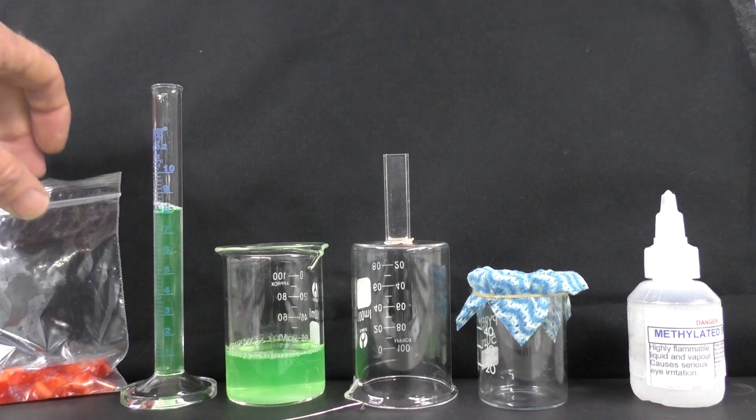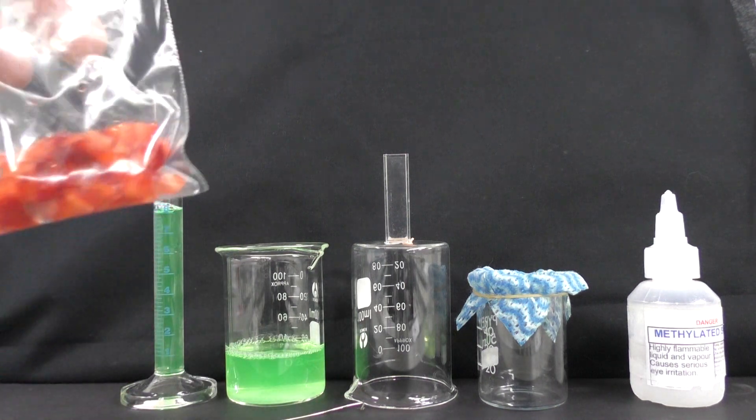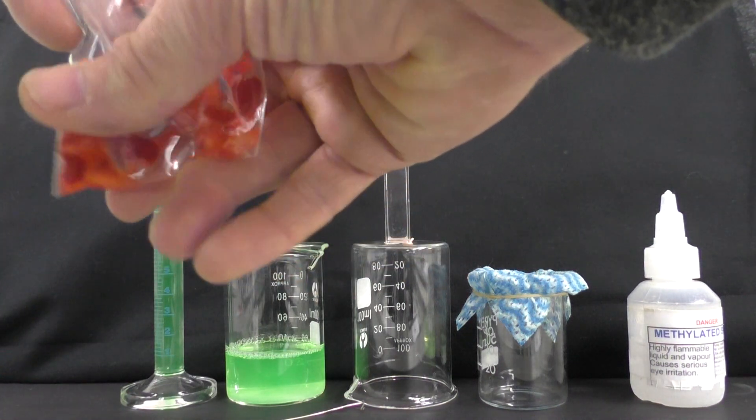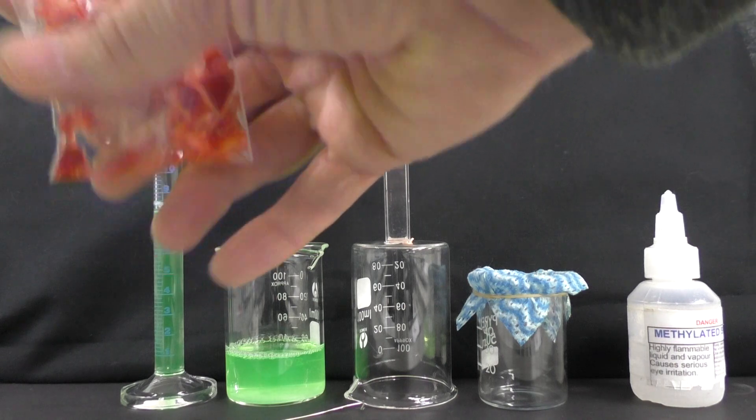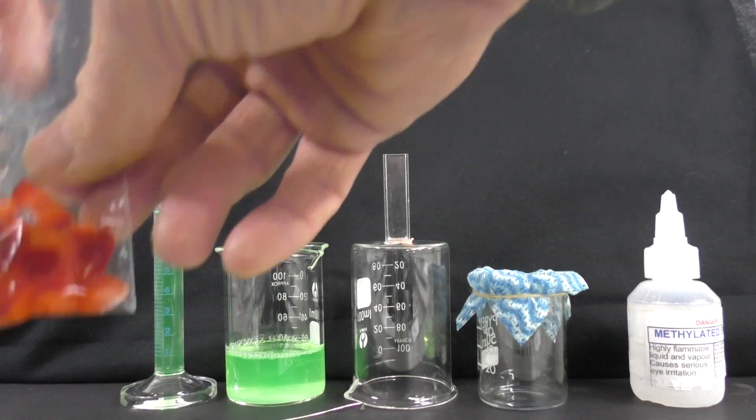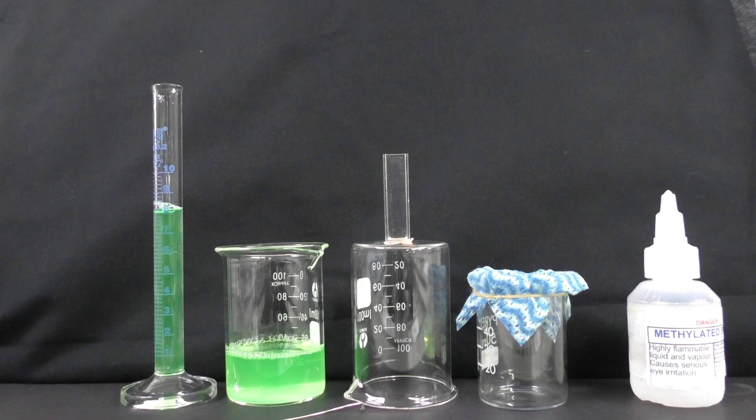We're going to start off by giving the strawberries a bit of a mash in here. So we'll just give them a little squeeze up. Let's give it a good squeeze. And that's going to be about five minutes spent doing that.